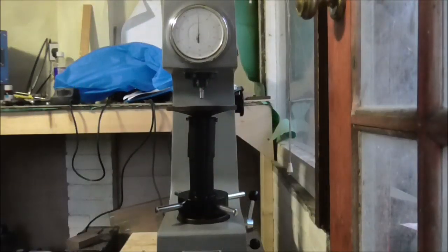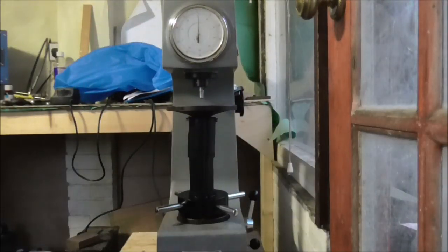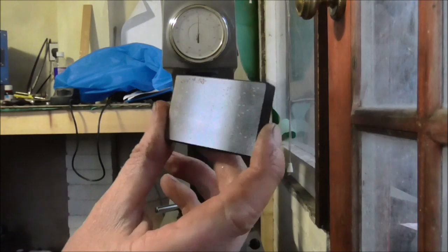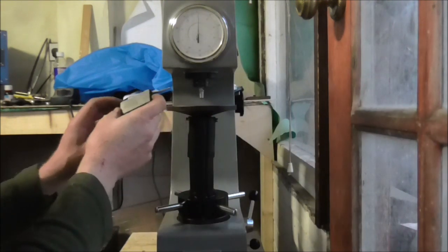Well this machine cost me a lot of money. I spent the last few hours setting it up and calibrating it. I've more or less got it where I want it now. I'm using a calibration block here to set the actual calibration of the thing.